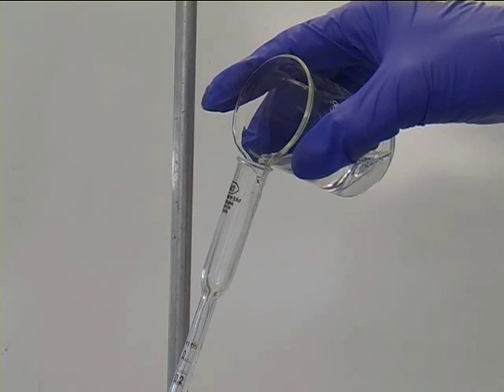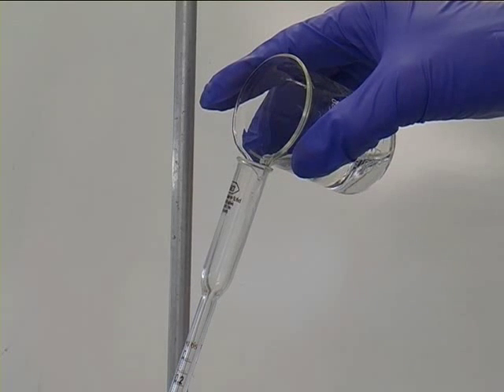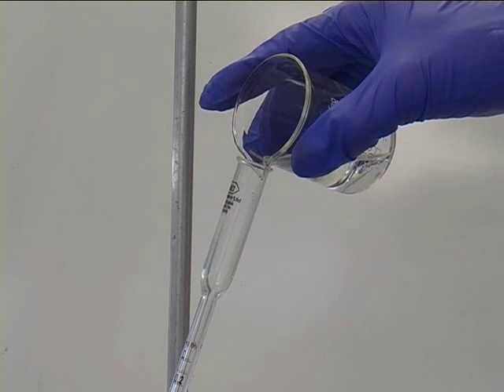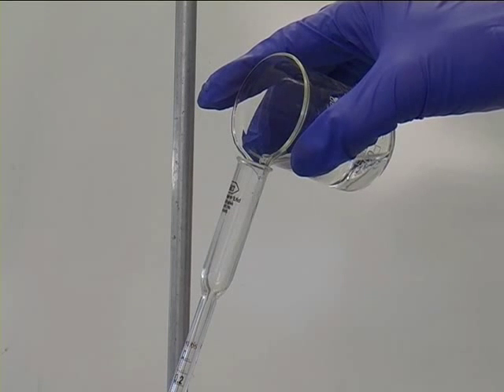This is how to correctly fill a burette. You may find it easier to take the burette off the clamp and hold it in front of you. You are filling at an angle to ensure there are no bubbles trapped inside.